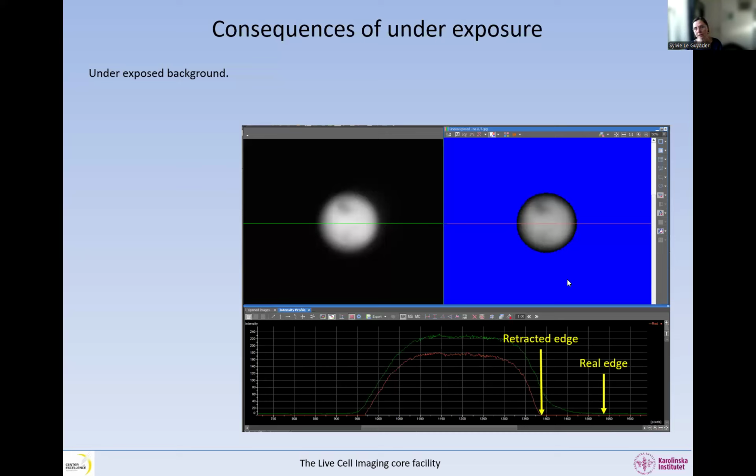But if we have an underexposed background, then the edge looks retracted like this. And why is that? It's because all these very dim pixels around the bead, we are basically telling the detector, do not detect them. So we are setting our parameters in such a way that the detector is unable to detect the dim details in our image. So that's not very good. This is not detected, so you cannot do anything afterwards. So there are no details at the edges, and we get the wrong size. We are going to have smaller objects, instead of larger ones as with saturation.